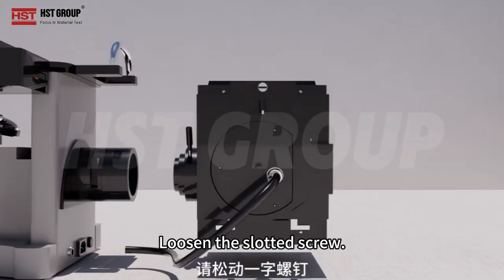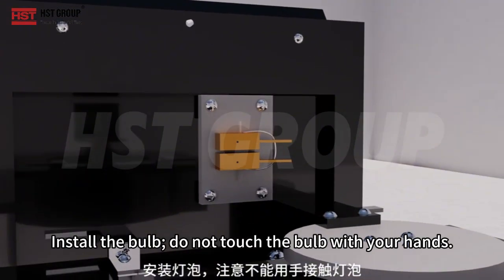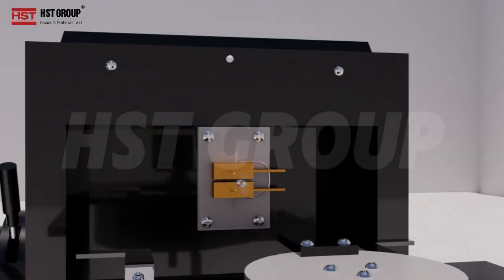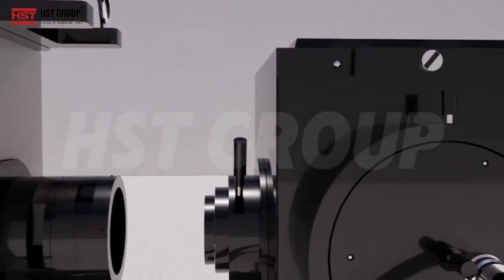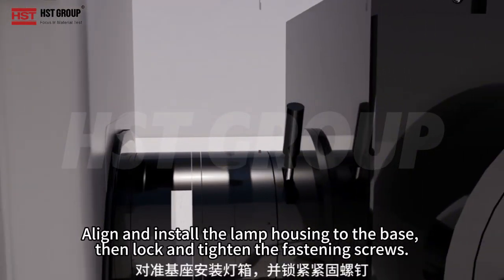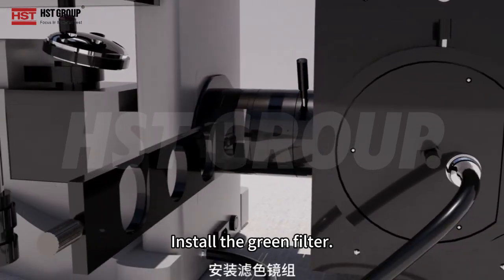Loosen the slotted screw. Install the bulb. Do not touch the bulb with your hands. Align and install the lamp housing to the base, then lock and tighten the fastening screws. Install the green filter.